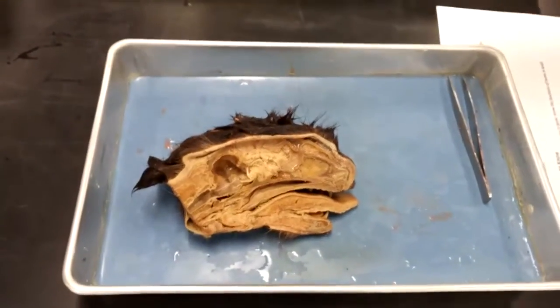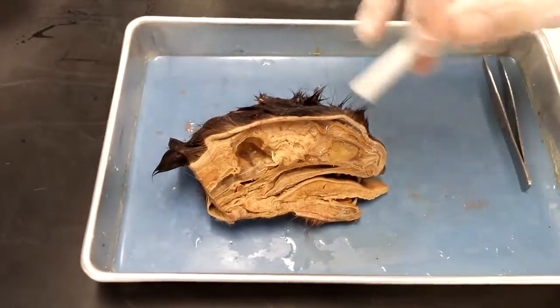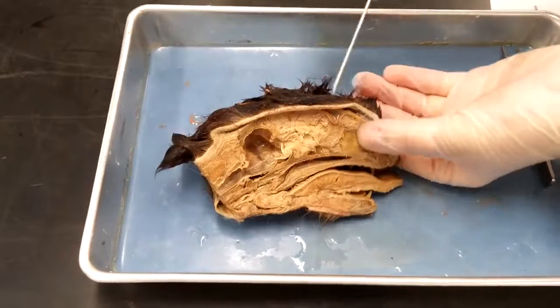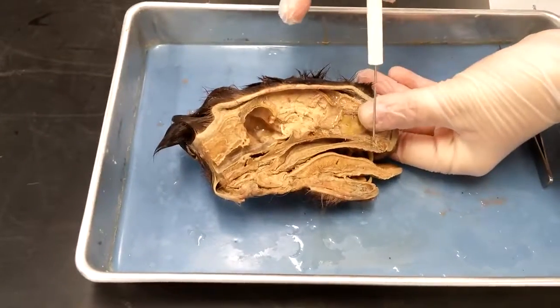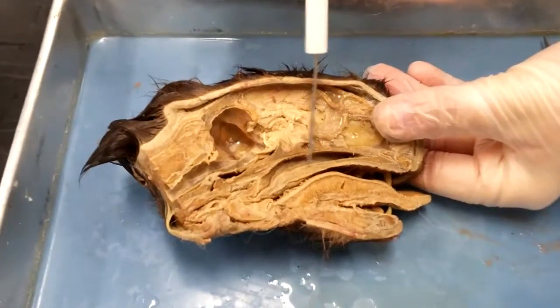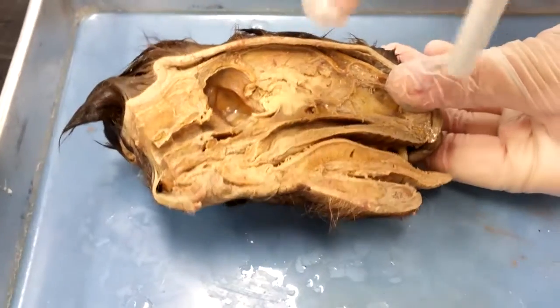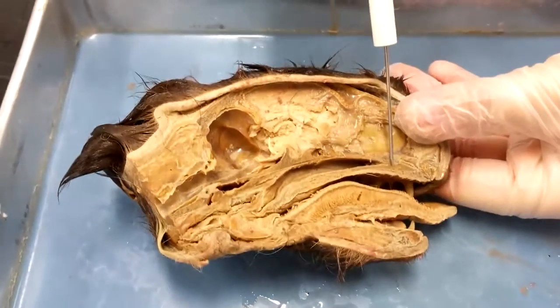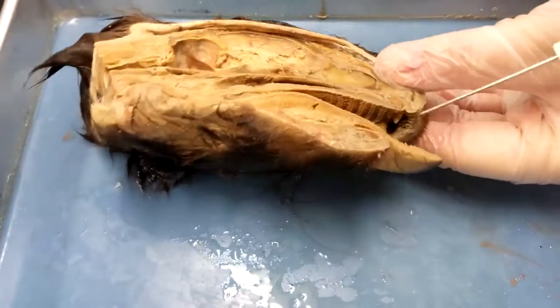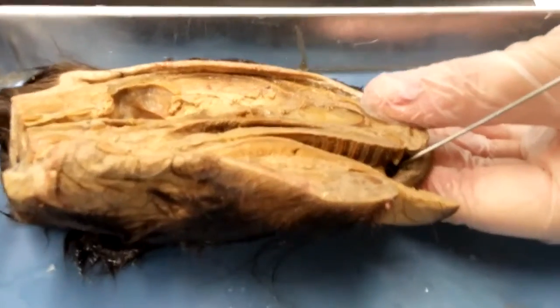We're doing the cat, and we're doing the head and the head structures. The first thing we have is the hard palate, which is this bony part right here. The next thing is the vestibule, which is the space between the teeth and the lip.